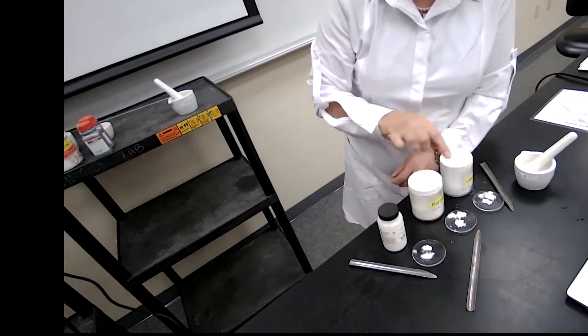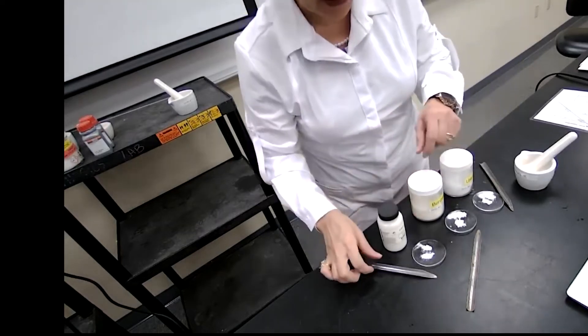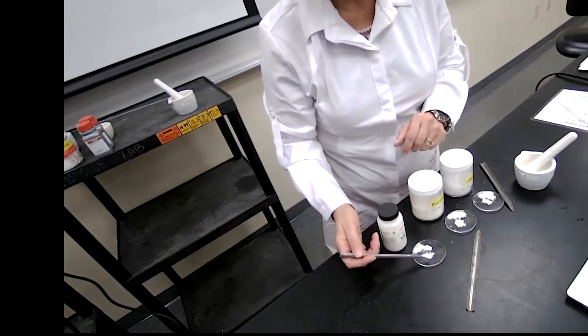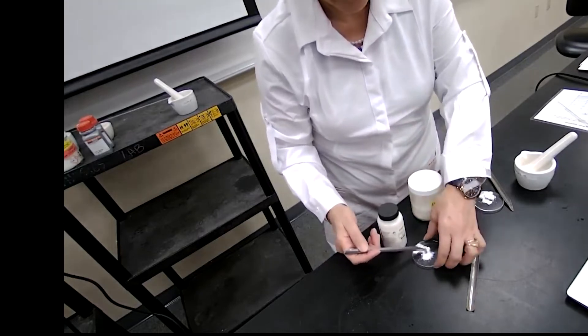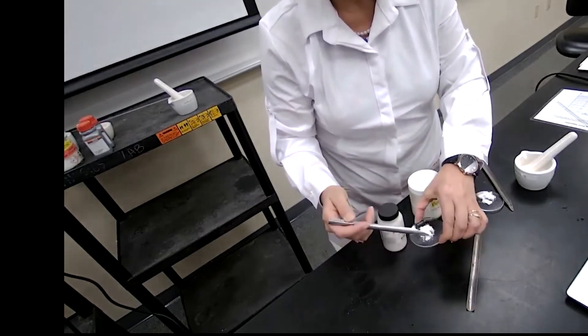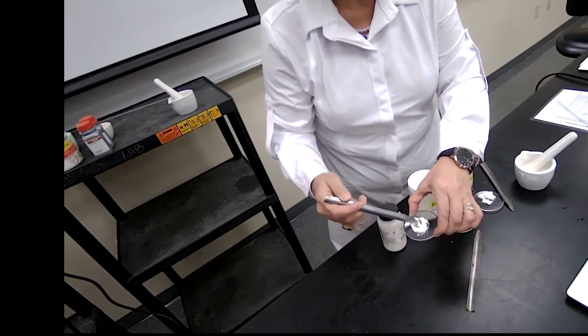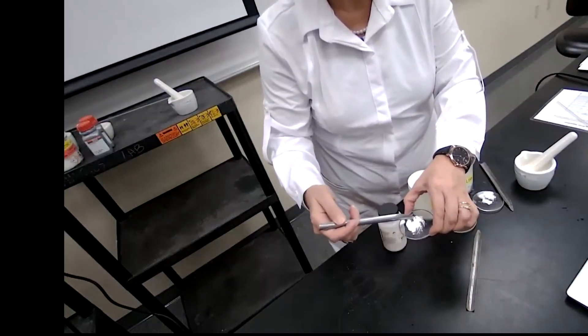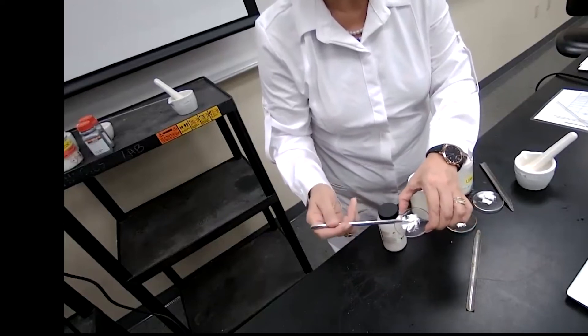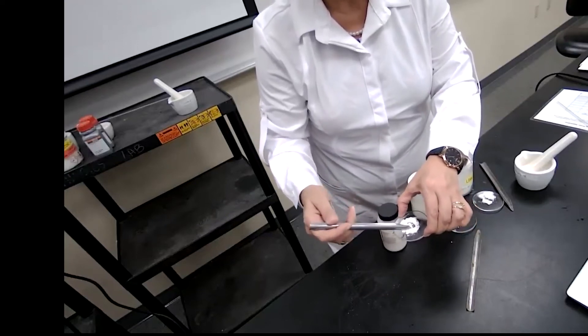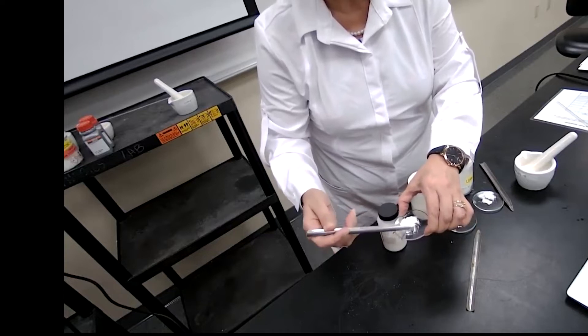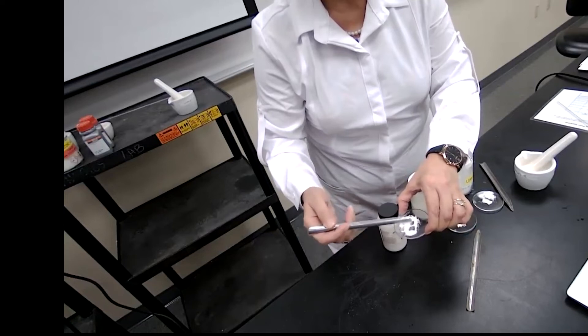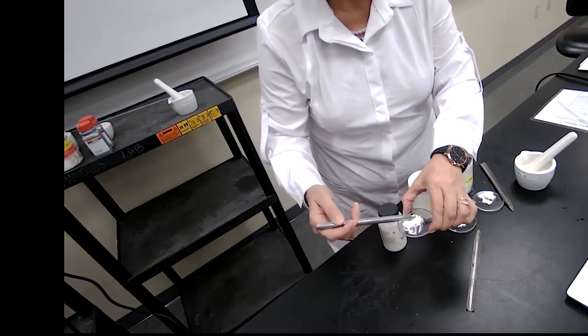I'm mixing a 50/50 percent mixture. So I have 50 percent by weight of the unknown, 50 percent of the aspirin. I mix it well to make sure that I have like an even sample. So what gets into the capillary tube is going to be an even sample of this. And both of them are grinded and mixed well for this, for the aspirin.